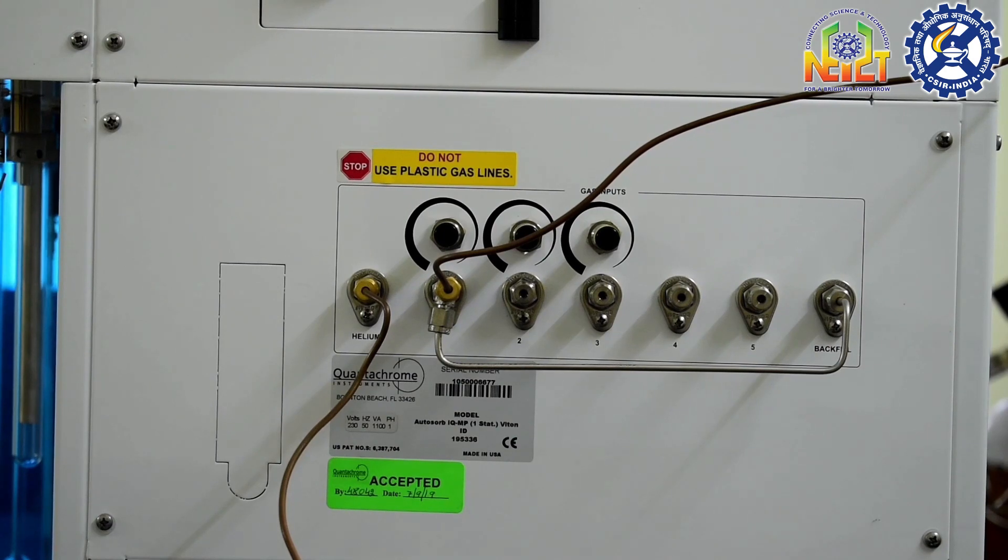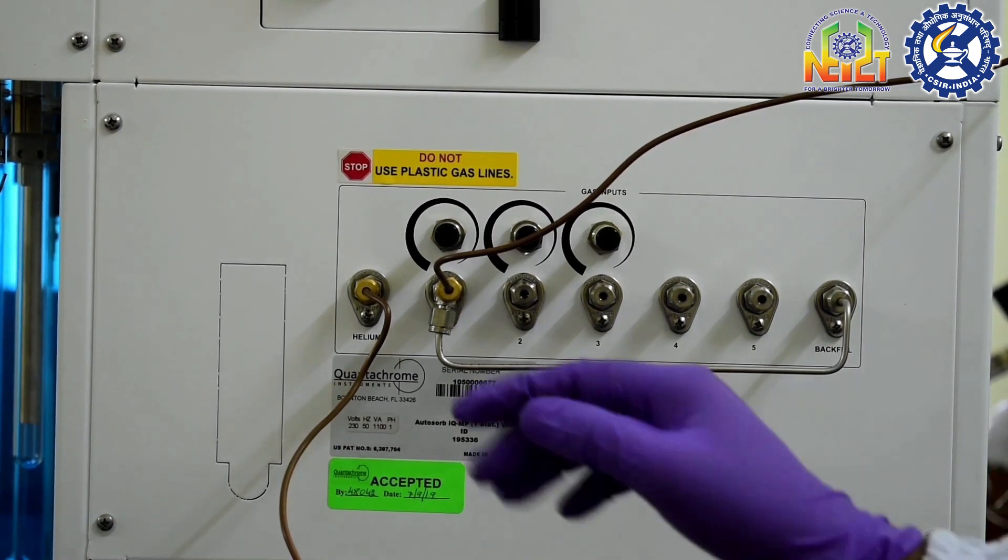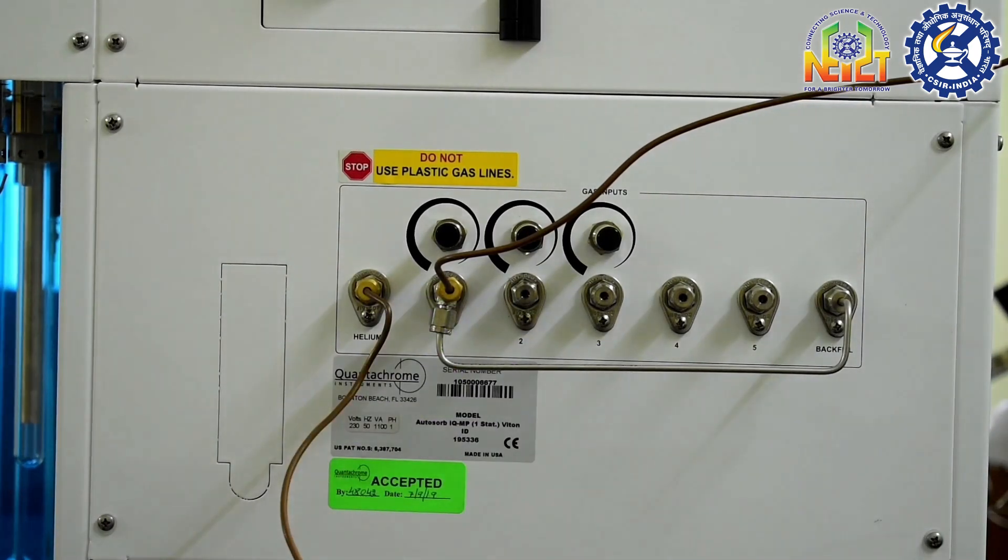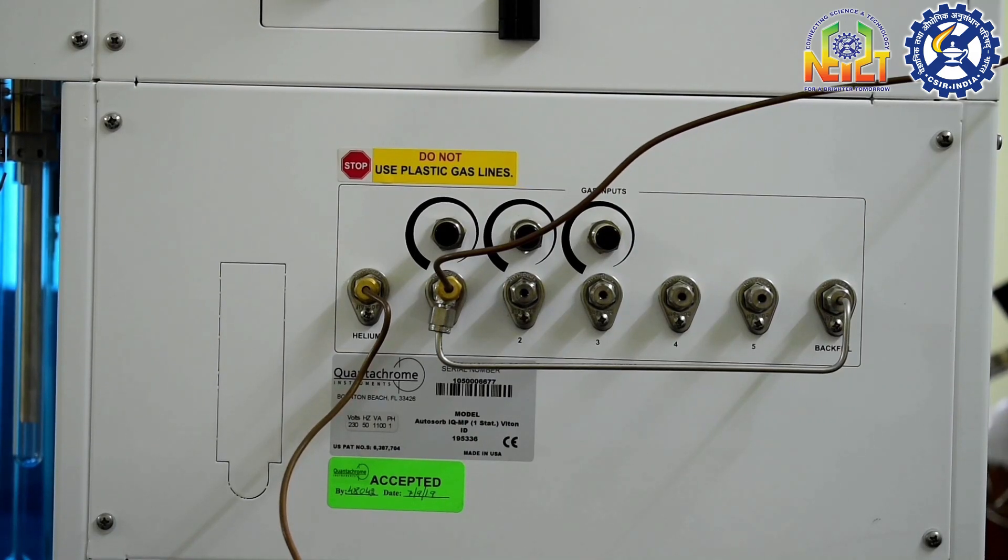The last gas port is only for backfill gas. The gas ports between the helium and the backfill gas are used for adsorptive gases. We basically use nitrogen as adsorptive gas.